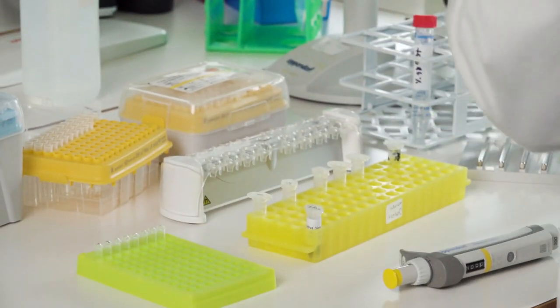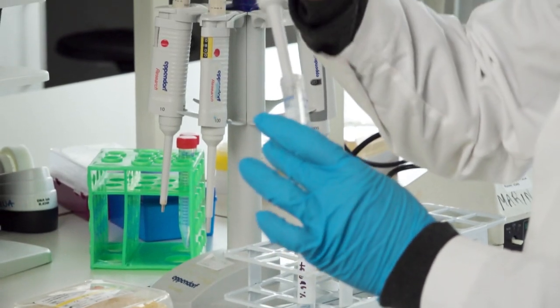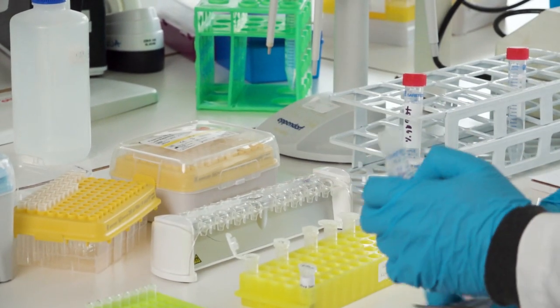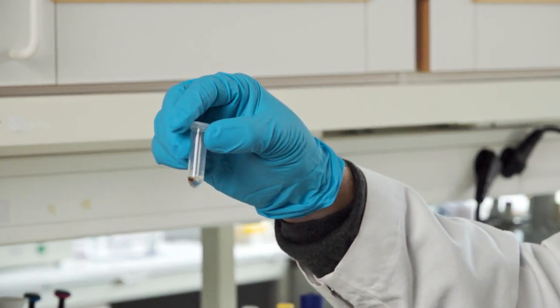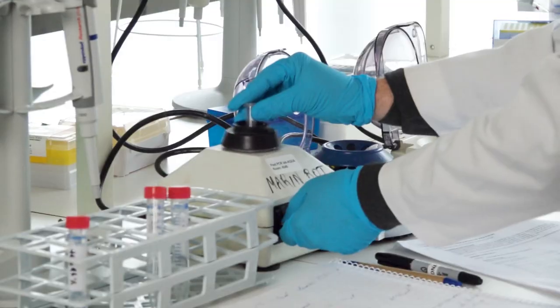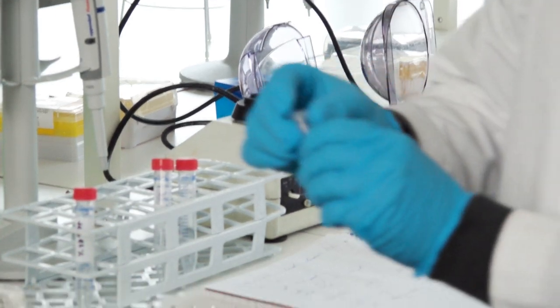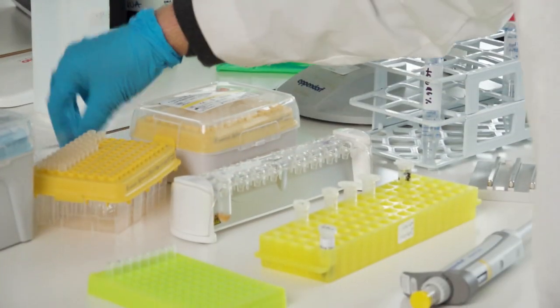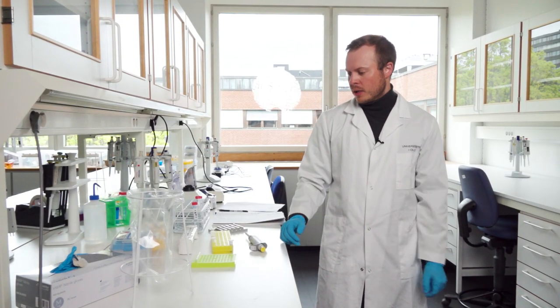For the second wash: open the tube containing the PCR products and beads, suck out the ethanol from the previous step, add fresh ethanol, close everything. There should again be a clear brownish bead spot — partially dissolve it with vortexing, spin down briefly to clear the lid, then you have a brown solution again. Place it on the magnetic rack for another minute and wait for the solution to clear up.